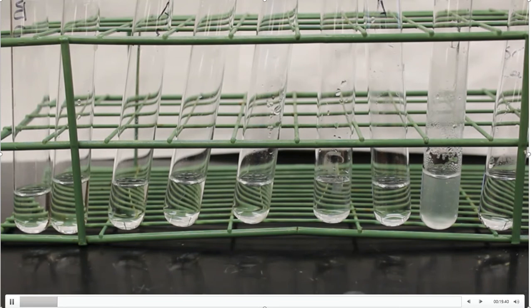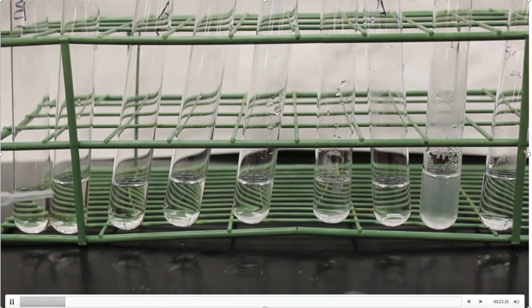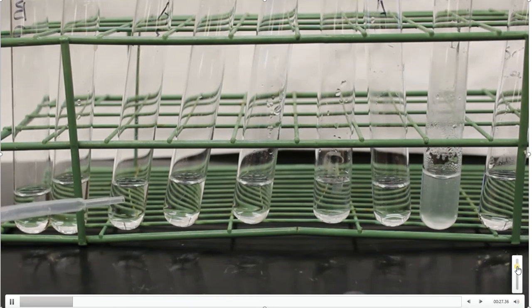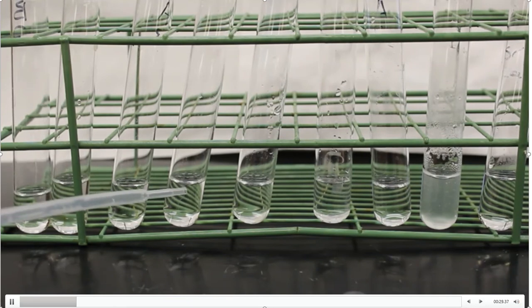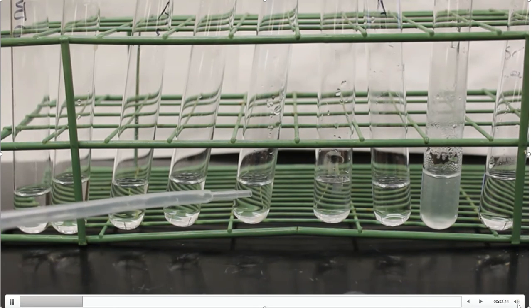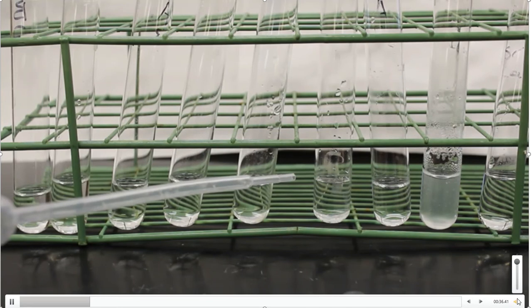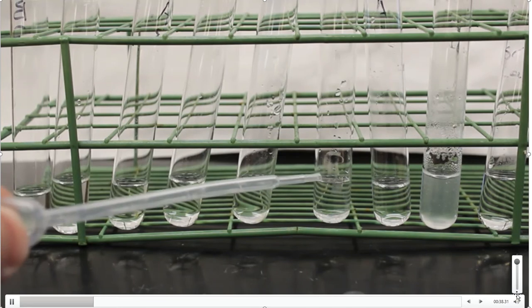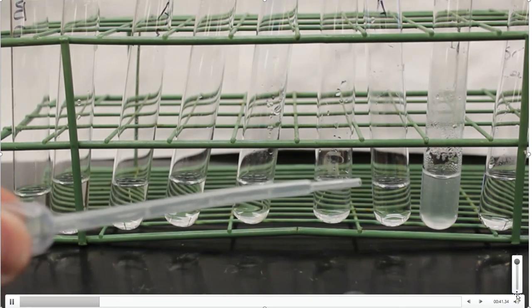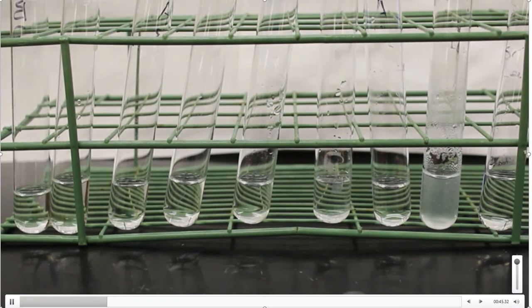The order that I have these up: the very first one is sucrose, then fructose, then maltose is the third one. We have unknown number one, unknown number two, then we have lactose, xylose, starch, which is next to last, and then finally glucose at the very end.